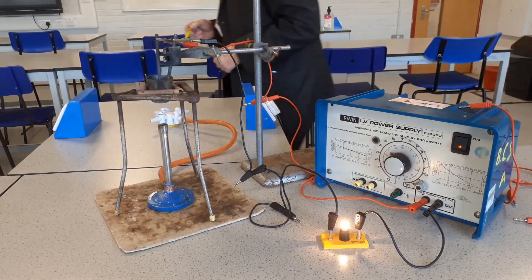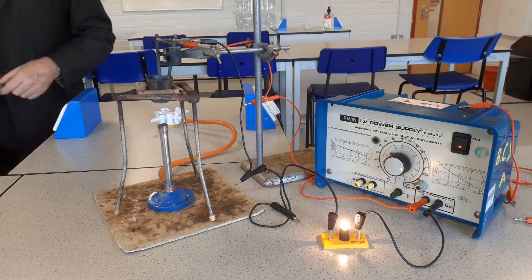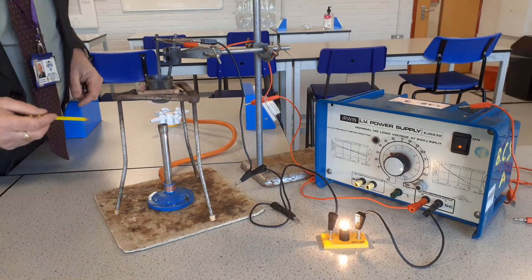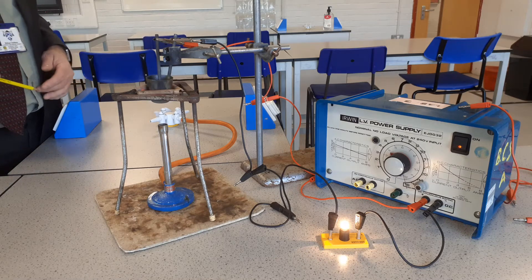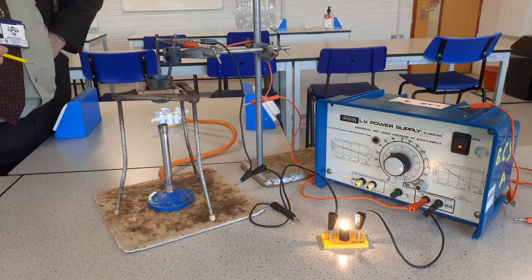As a result of that, we are getting chemical reactions occurring at the two electrodes. I need this to be a bit hotter yet before I can point out what the products are.